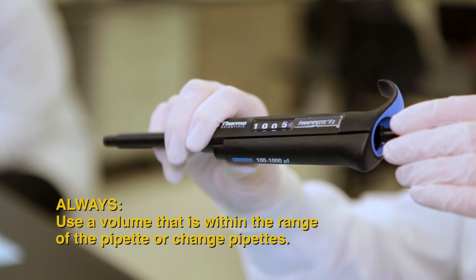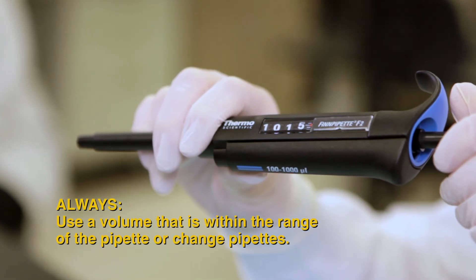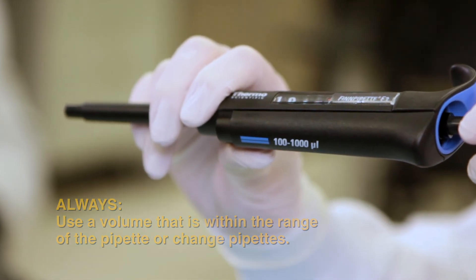Do not use a pipette past the volume limits listed on the handle. Not only does this cause inaccuracies, but also damages the pipette.